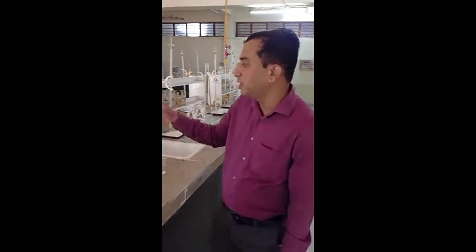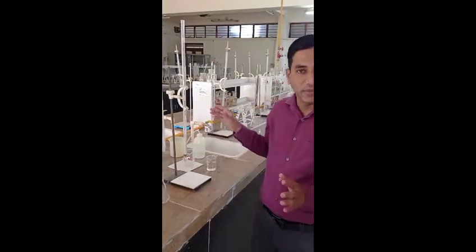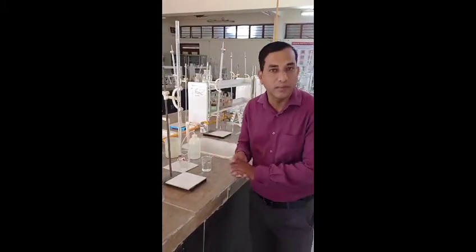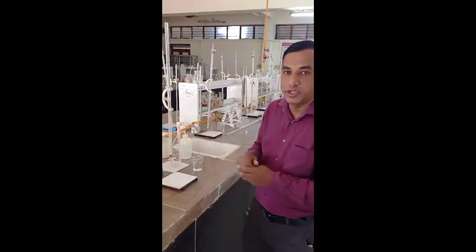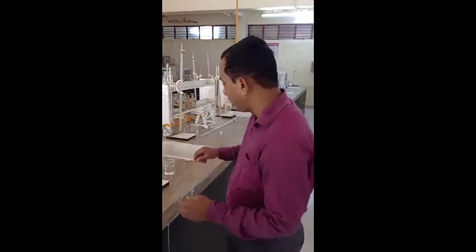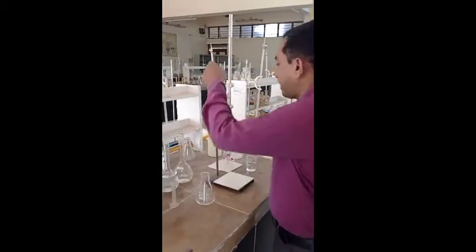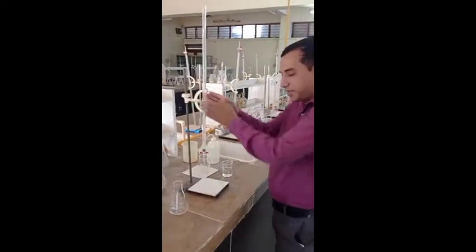The first parameter is total hardness. For total hardness, we determine it by the complexometric method, where we are titrating the water sample with EDTA. After calculation, we calculate how much amount of hardness is present in the water sample. For this we take a water sample and titrate it. In the burette we are taking EDTA.